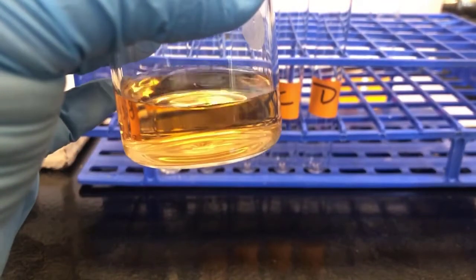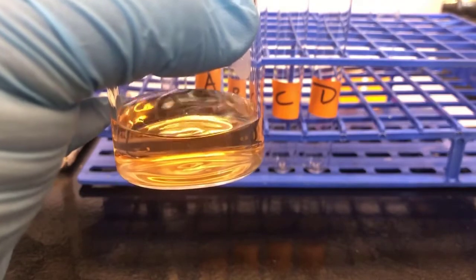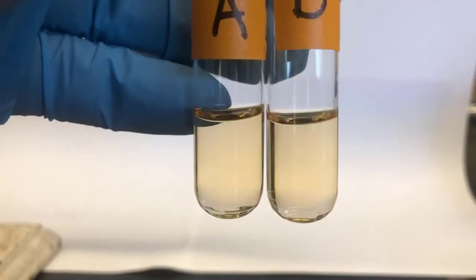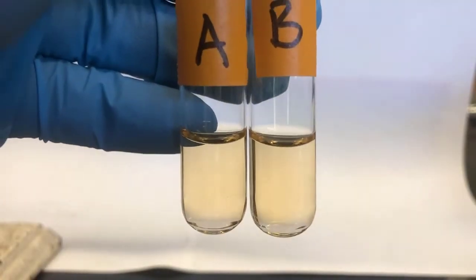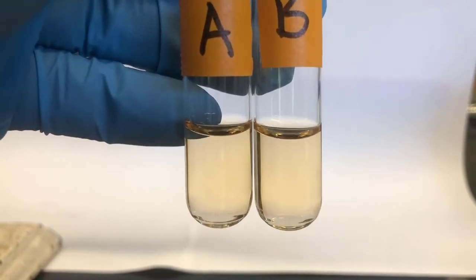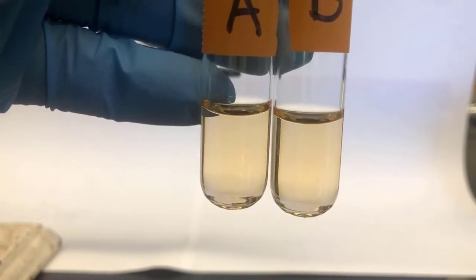Like that. Now we're going to fill each of these test tubes up to the 3 ml mark. So I'll stop the video, and when I start it, they'll all be filled, okay? So there's tubes A and B, and A is your reference. I'll add ferric nitrate to tube B, about 10 drops, which for this dropper is about 1 ml.